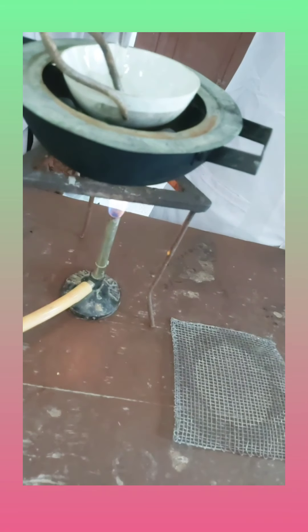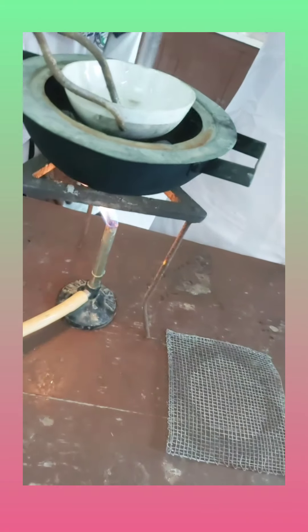After a period of 30 minutes to one hour, they are going to cool the mixture down and then see the product in crystal form. I'm standing outside the lab because the benzaldehyde and the other compounds are very pungent — they are carcinogenic and very toxic. Day before yesterday I was standing inside and was totally breathless, so today I don't want to be ill again. The fume hood was apparently not working well, which is why I am not feeling well today.